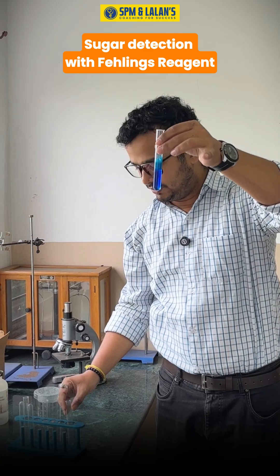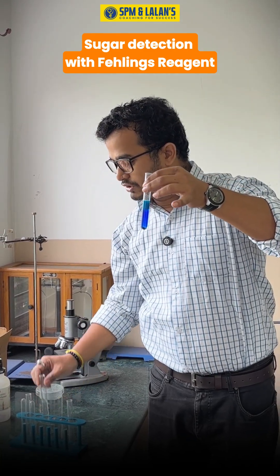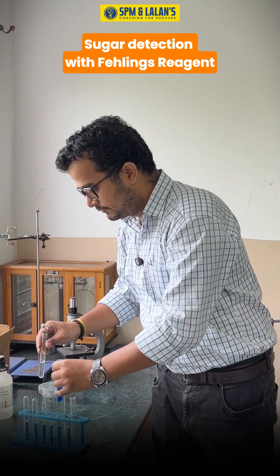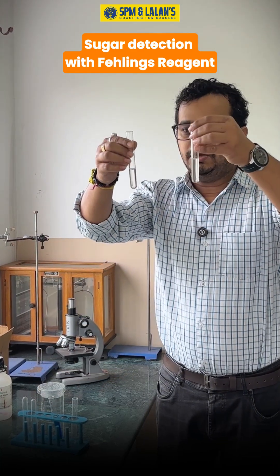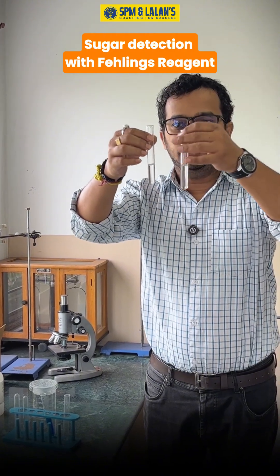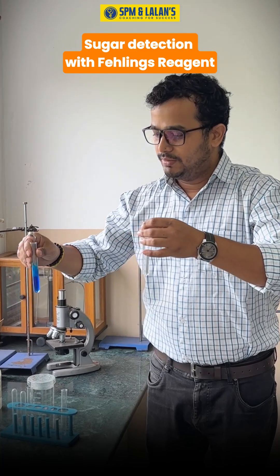Now what we have to do is check whether our solution contains sugar or not. For that, I took two samples — in one sample I added sugar, and one sample is normal distilled water. I have to check which solution contains sugar and which does not. For that, I will add a mixture of the Fehling's solution.